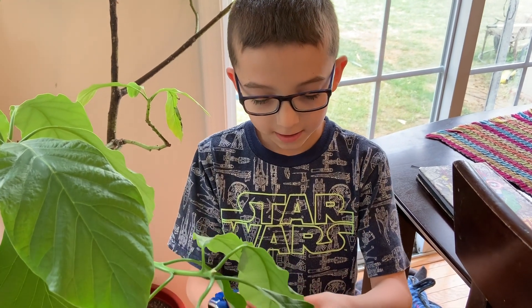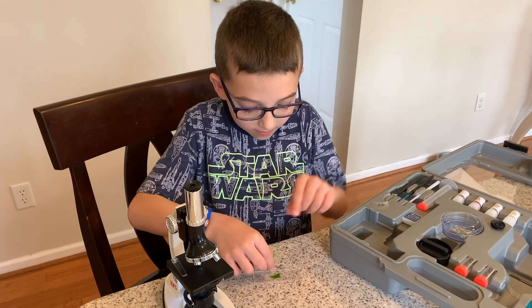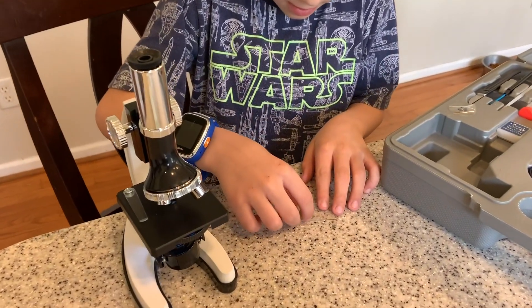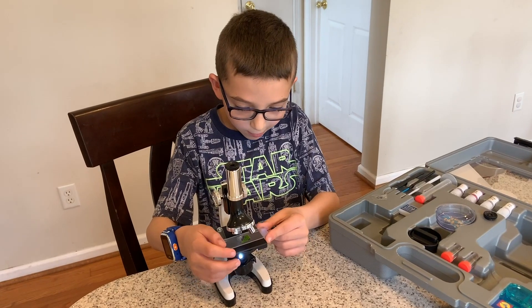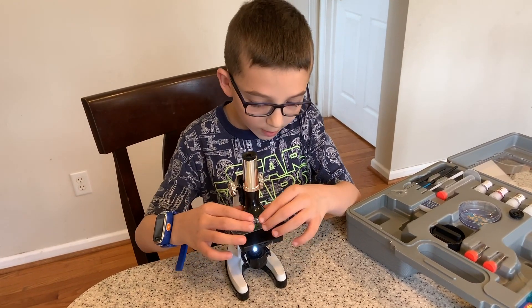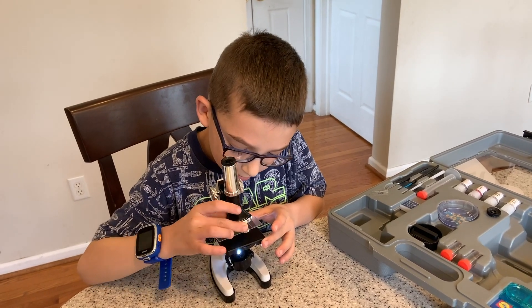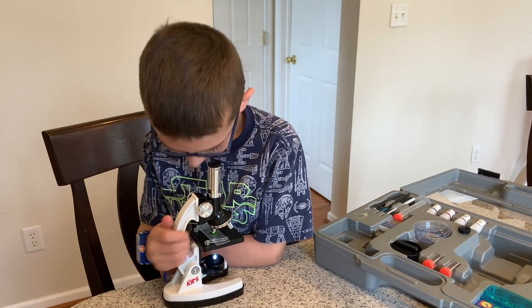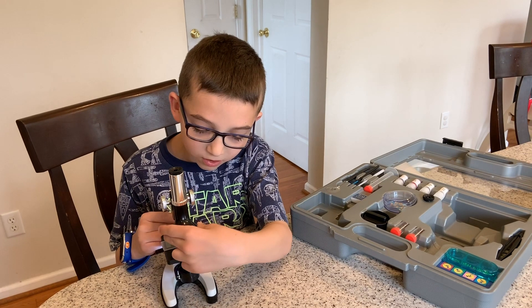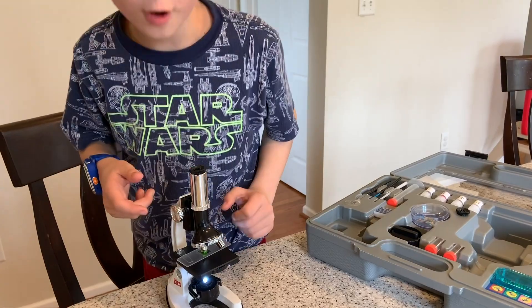I'll look at this plant next. This is an avocado leaf. I'm going to put it on my slide and I'm going to put a slide cover on it. Next, I'm going to put it under my microscope and put it on 300 times. Let's take it up to 600 times. I see particles — you take a look. Let's take it up to 1,200 times. I see more particles.